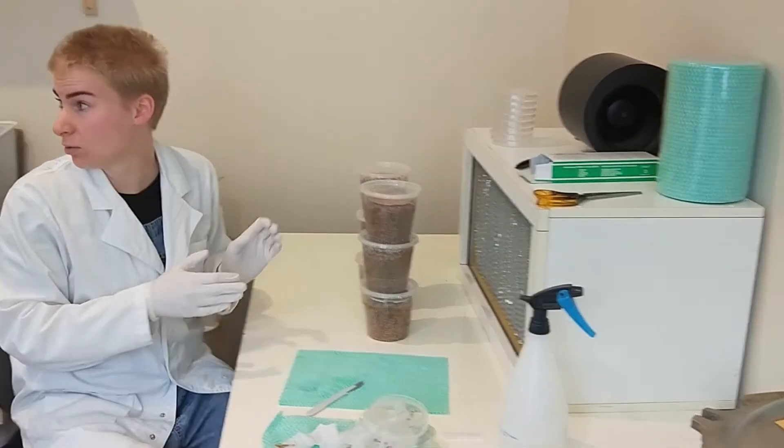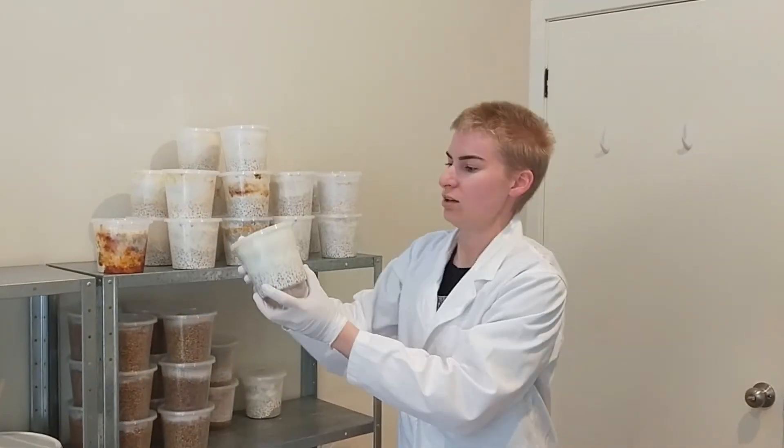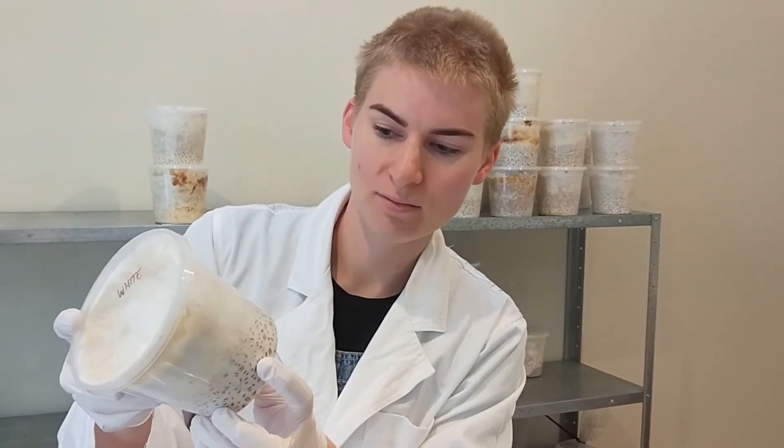So in a couple of weeks they will look like these guys over here. The mycelium will have come fully through the grain and colonized it, and at that stage you'll be ready to move on to a fruiting substrate.